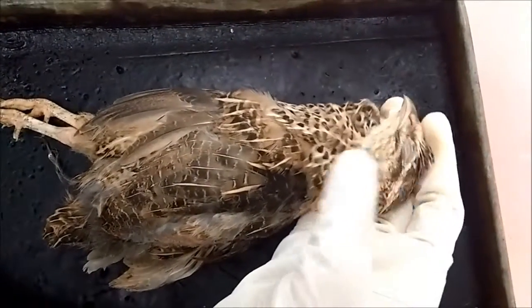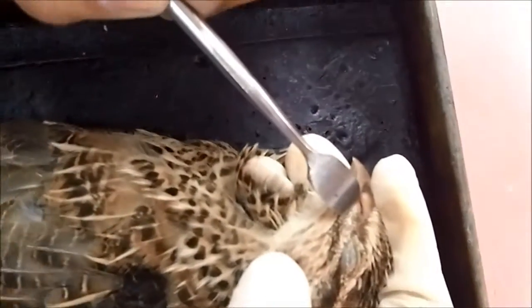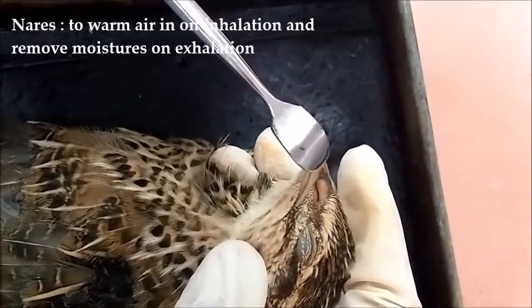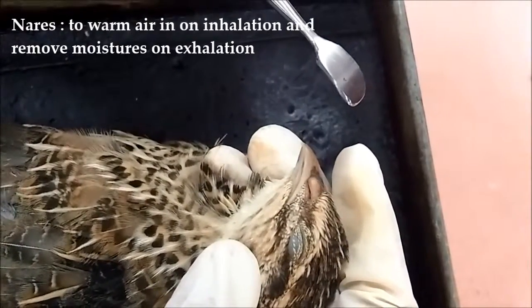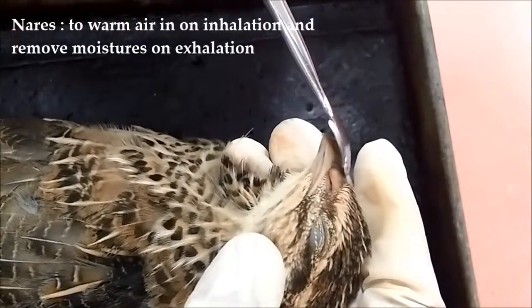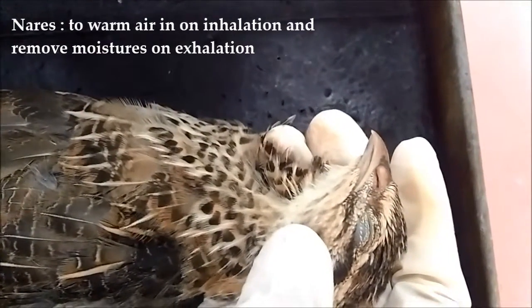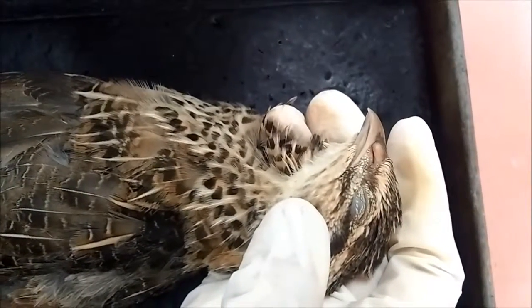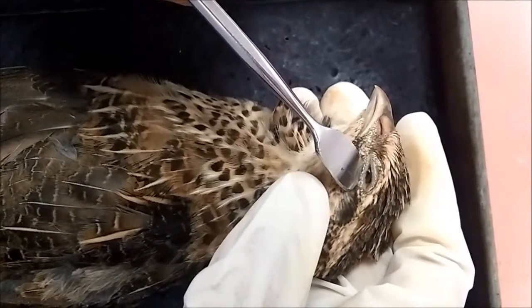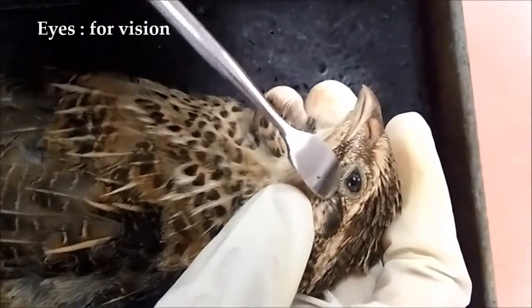And then the second part is the nares. You can see here, this is the nares. The nares is also known as the external nares, located near the beak base. This is the beak base, and this is the nares. The third organ is the eyes. You can see these are the eyes of the bird.